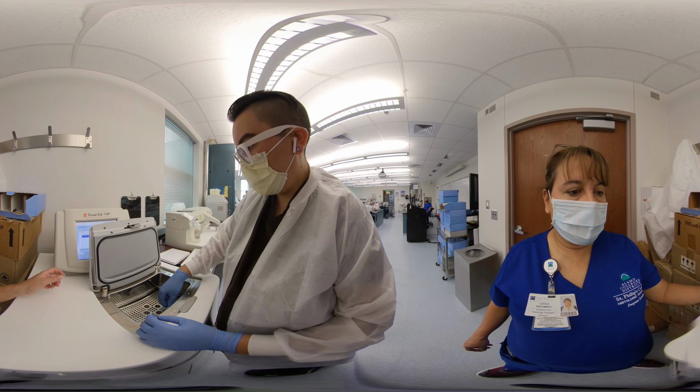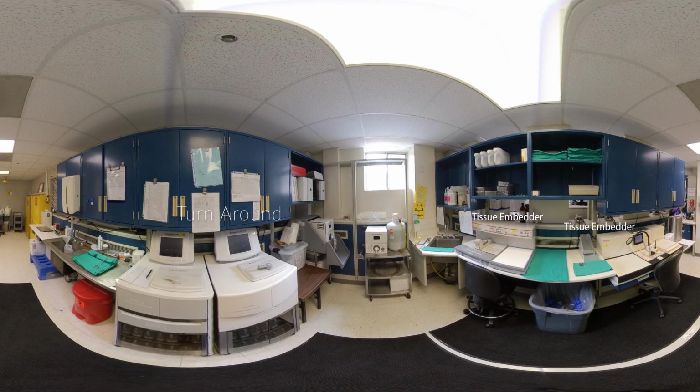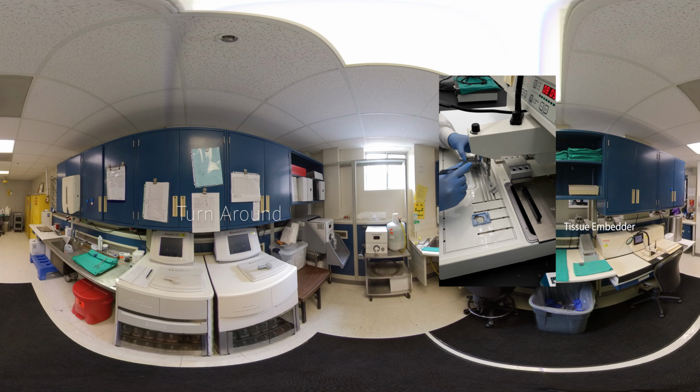Once tissue processing is completed, the tissue is removed from the tissue processor and transferred to the embedder. Here are the embedders you saw in your first lesson. Now let's take a look at what embedding looks like as it occurs. View the video over the embedder.